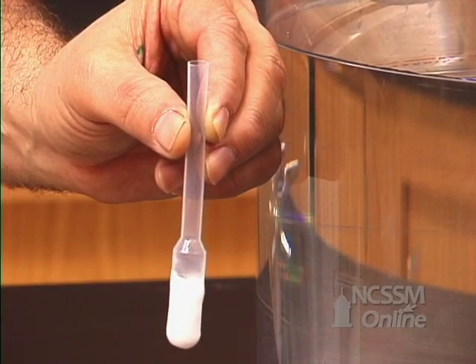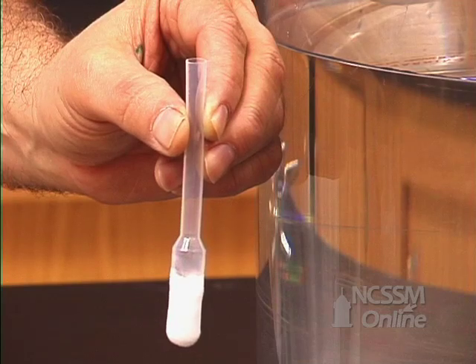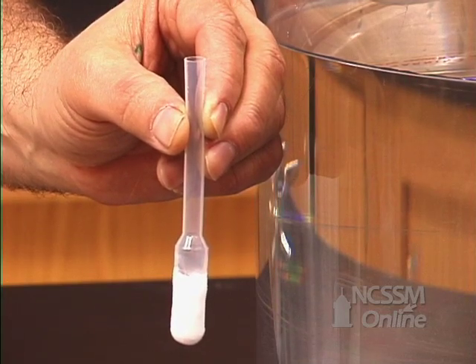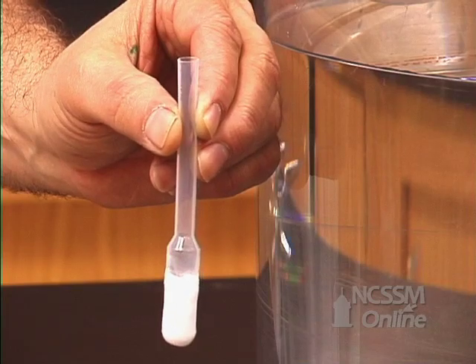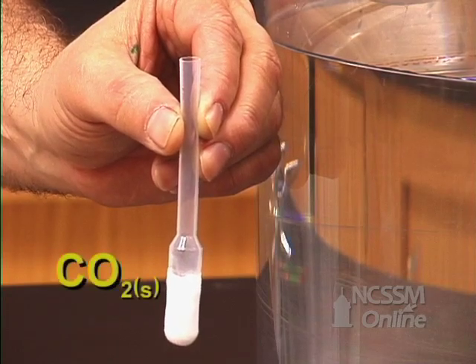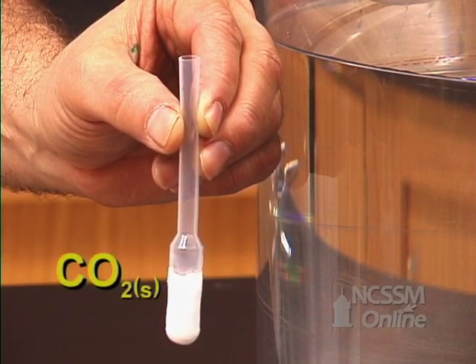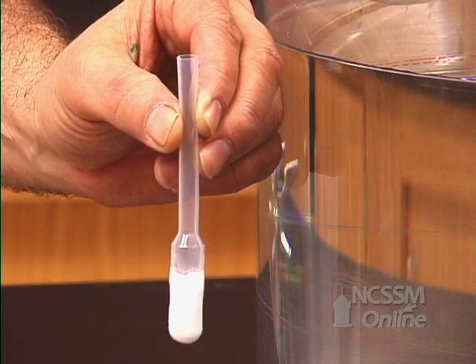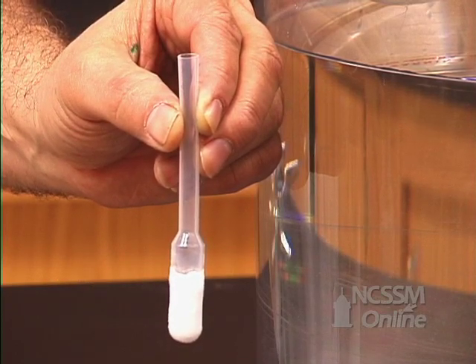We're going to look at the phase changes for carbon dioxide. We have some dry ice in a plastic pipette. At atmospheric pressure, the dry ice — the solid CO2 — will sublime and go to gaseous CO2.